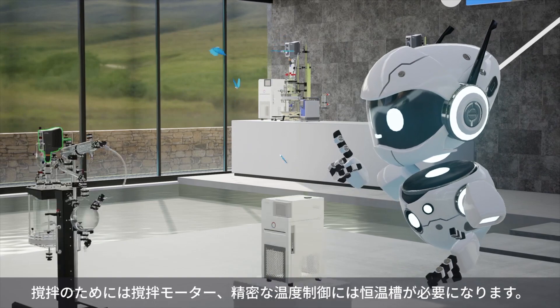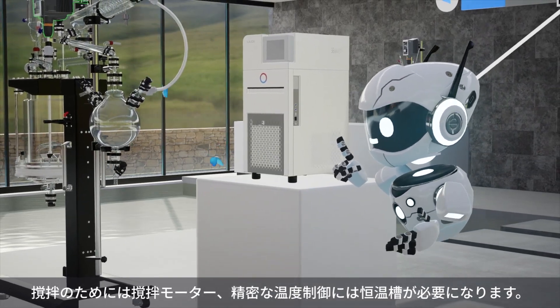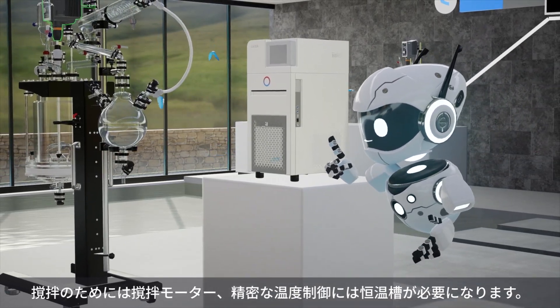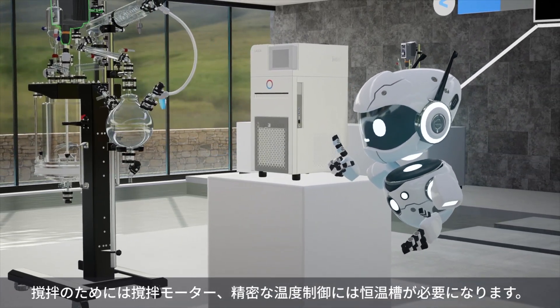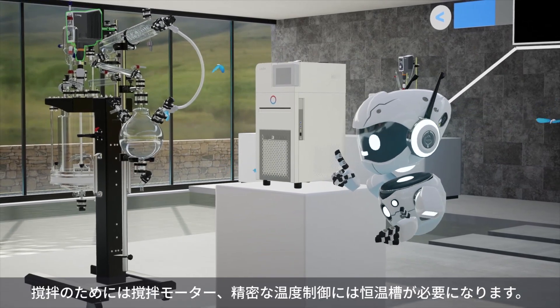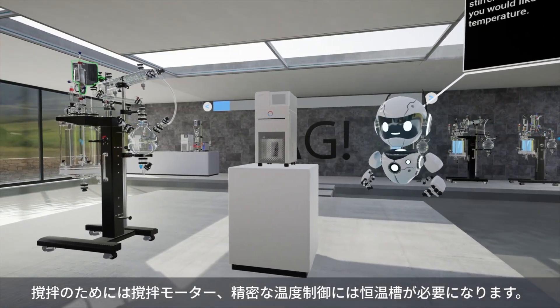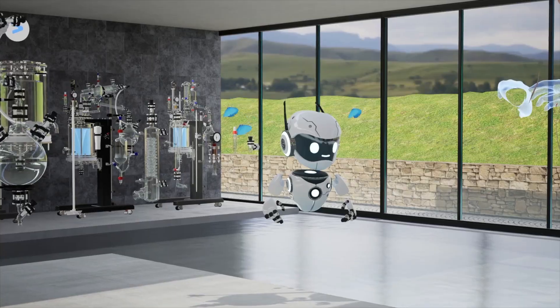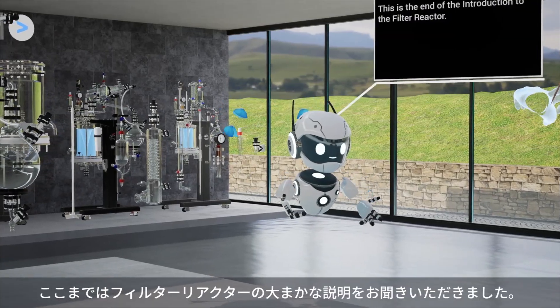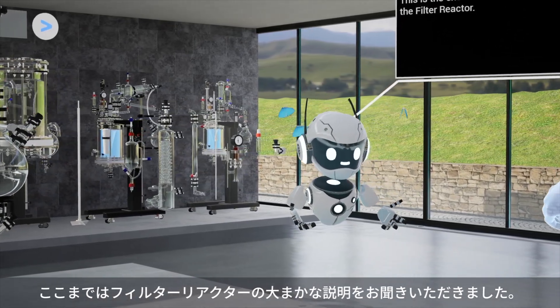The filter reactor requires an overhead stirrer for agitation and a thermostat if you would like to maintain a certain temperature. This is the end of the introduction to the filter reactor.